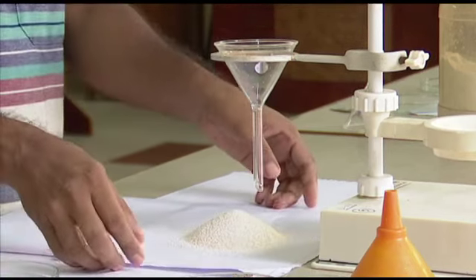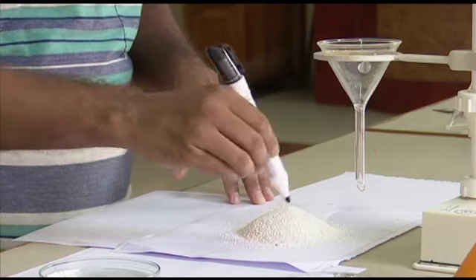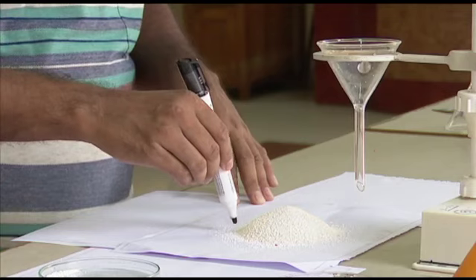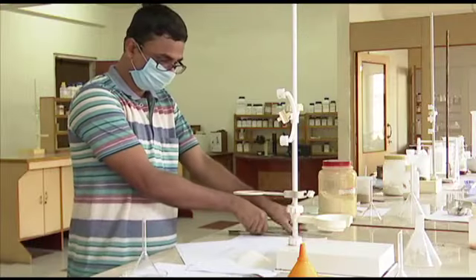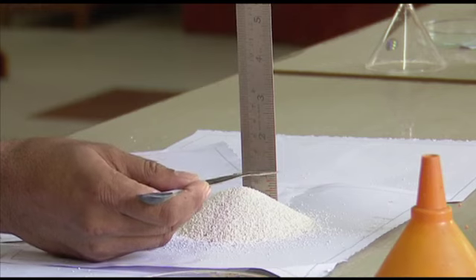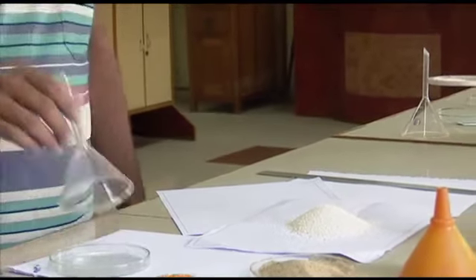Now he has to measure. He is making an outline, circular outline, not 1-2 points. Actually the objective is to get the diameter, but if it's not a perfect circle, you won't get the same diameter. That's why multiple points are taken. We have got a value of 2.1 centimeter. Now we have to go to the radius.